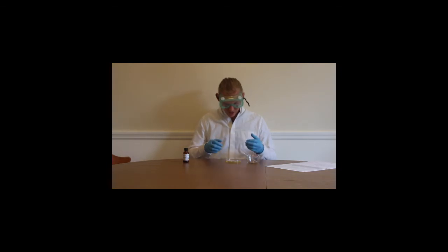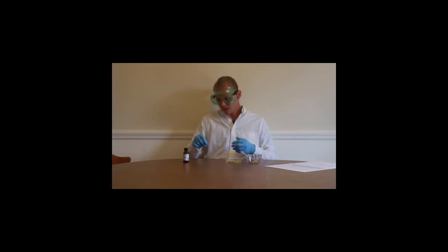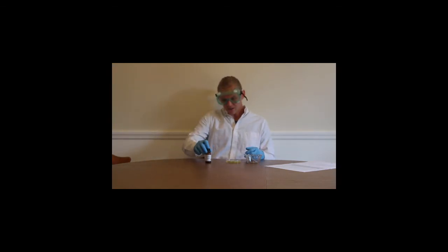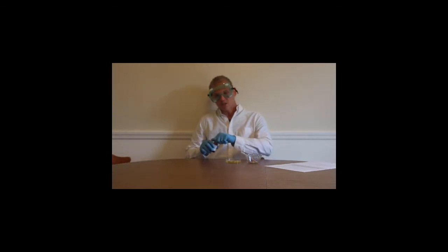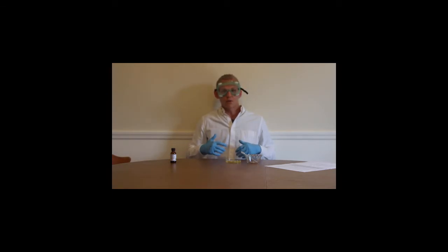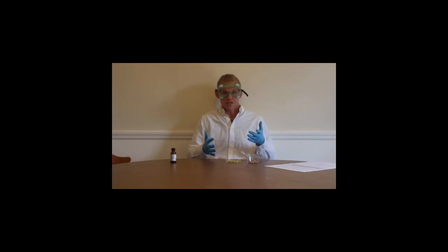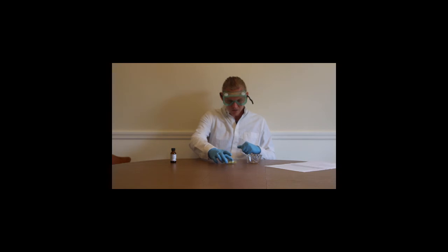Alright, so now that you've seen the experiment here and it's continuing to react, we need to safely dispose of all of our contents here and put things away in the best way that we can. So we have our bottle of sulfuric acid. I would promptly return this to our chemical storeroom myself and make sure that the cap is tightly sealed. And you can also see that I'm still wearing all of my lab equipment. Just because we're done with the experiment doesn't mean that you break down. You need to make sure the students understand this as well. We're still being safe.